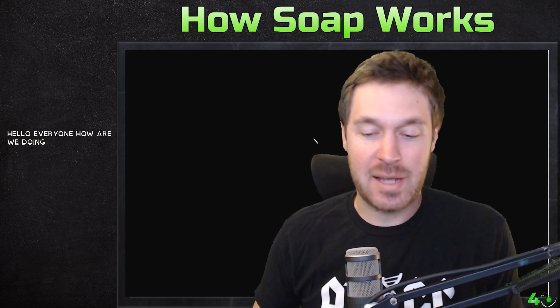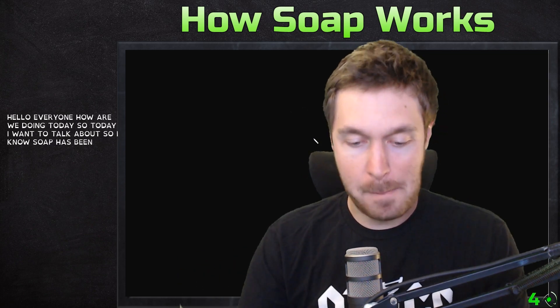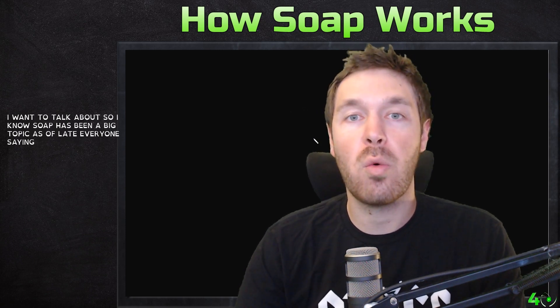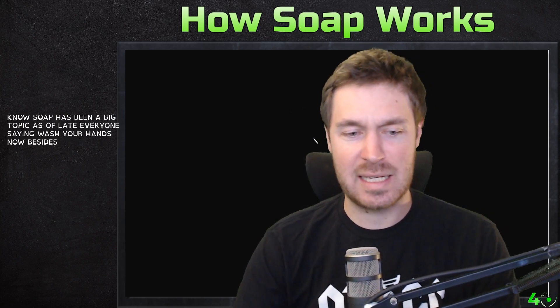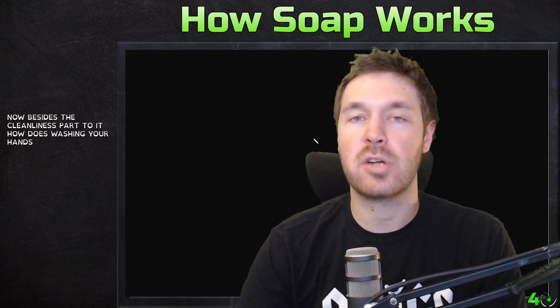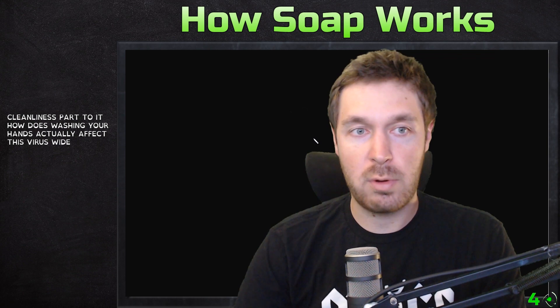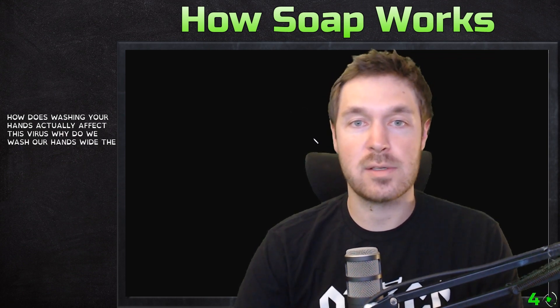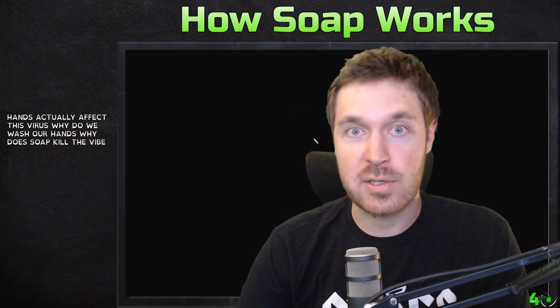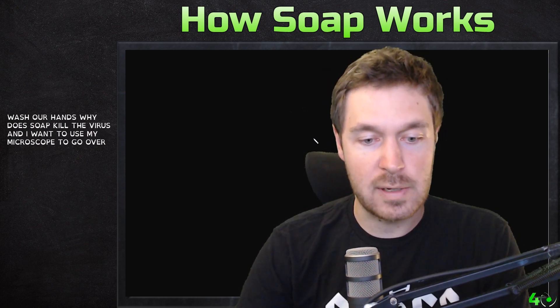Hello everyone, how are we doing today? So today I want to talk about soap. I know soap has been a big topic as of late. Everyone's saying wash your hands. Now besides the cleanliness part to it, how does washing your hands actually affect this virus? Why do we wash our hands? Why does soap kill the virus? So I want to show that today and I want to use my microscope to go over this.